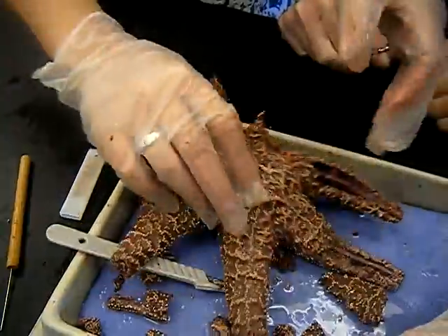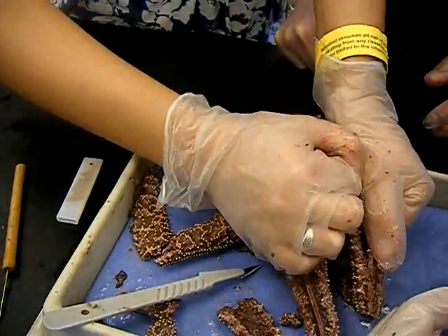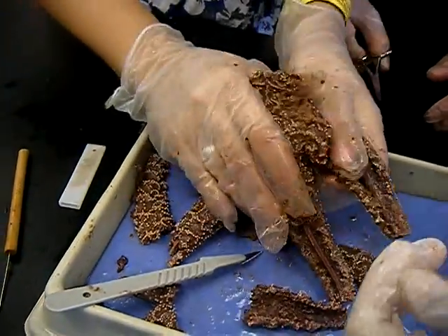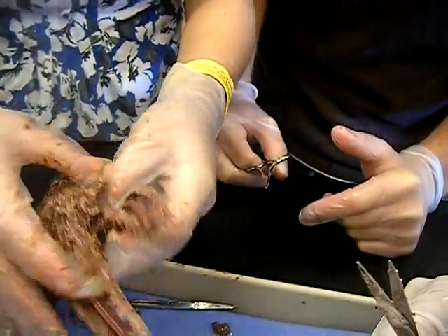Here we go. Okay, wow. That's not working out too well. You know what, Jimmy? Shut up. You gotta get under — the goal is to get under. Starfish gore. It doesn't even look like a starfish anymore. It's flexible now.